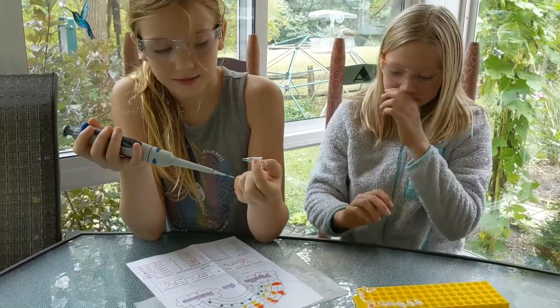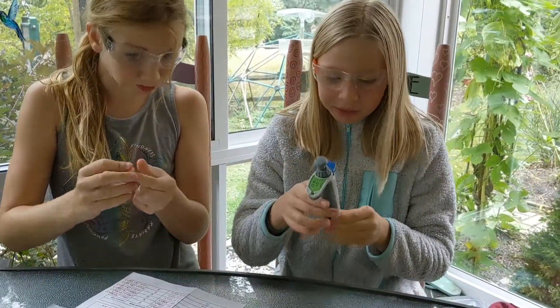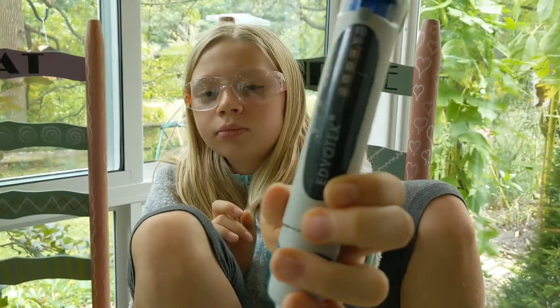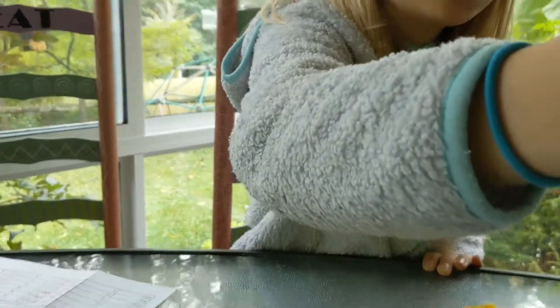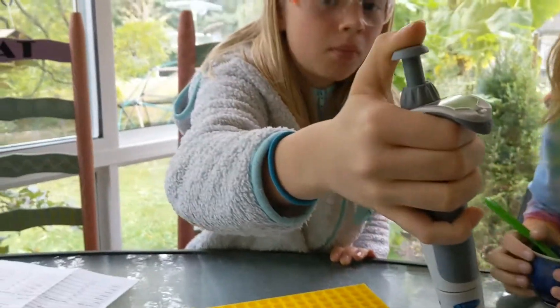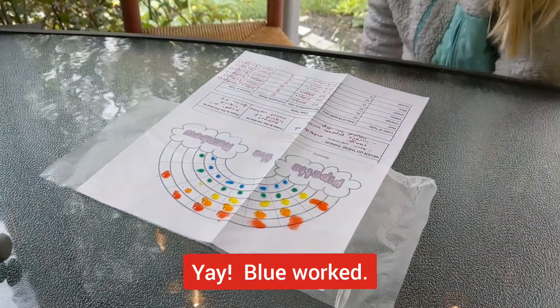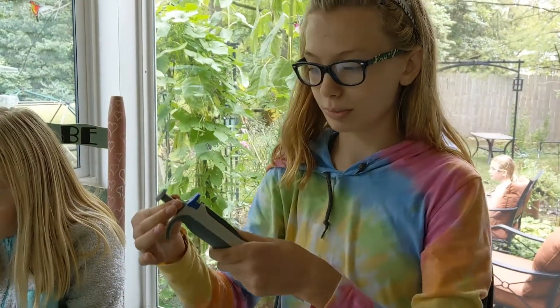Rowan is now going to do the blue. Change the micropipette to 10, and show it to the camera — it looks like 1,000 but it's 10.00. We're rinsing the tip because it's food coloring and we're conserving tips. I had enough, and for the blue category I was able to do all of the droplets. Now going down from 10 to 5 — 0,500 means 5.00.